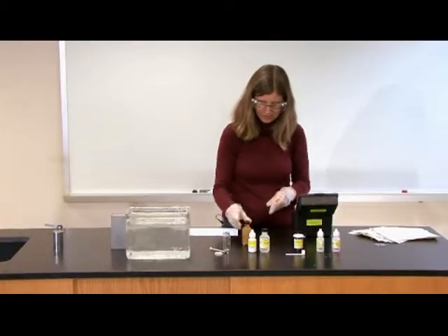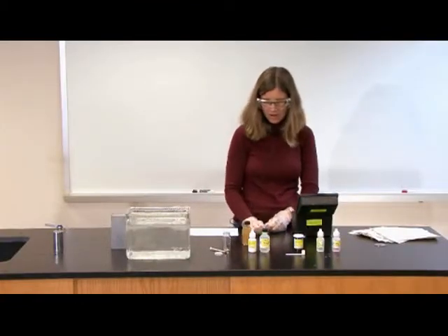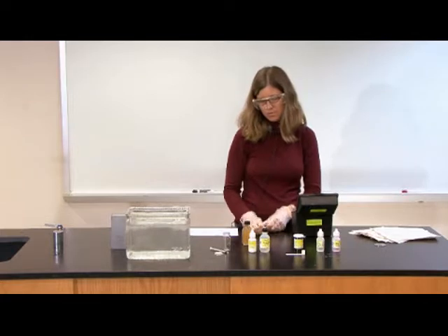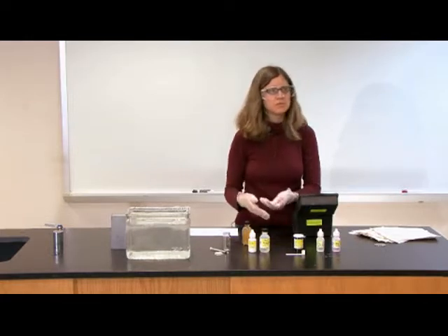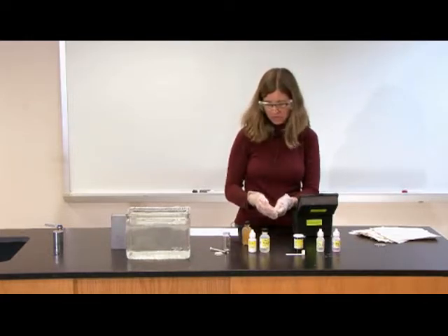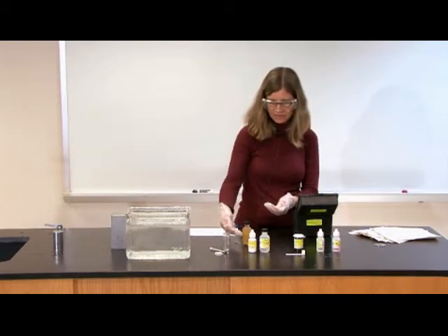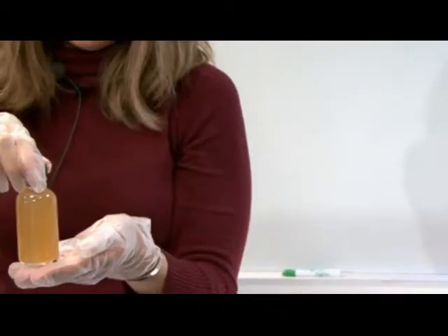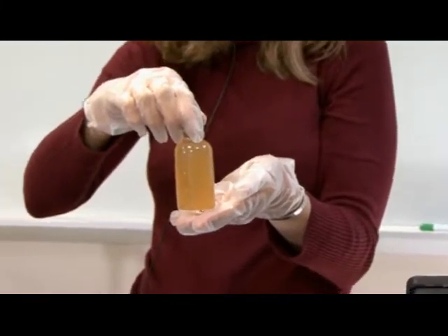And then I place the cap on my sample and mix it up. And then allow the precipitate to settle. And often students will want to go ahead to the next step before the precipitate is actually settled, but you do want to wait until the precipitate is at least about halfway down. While we're waiting, I'm going to go ahead and get out the next reagent.